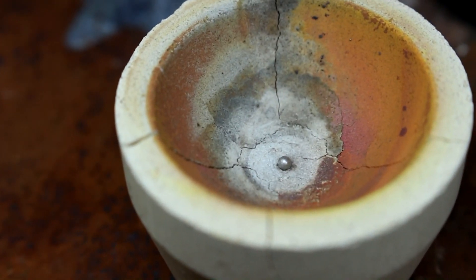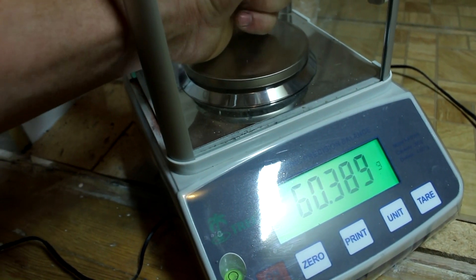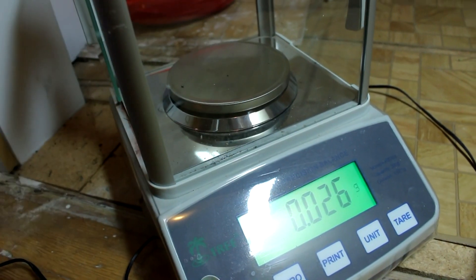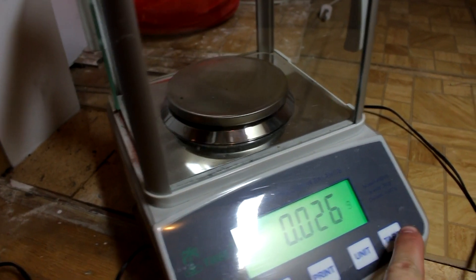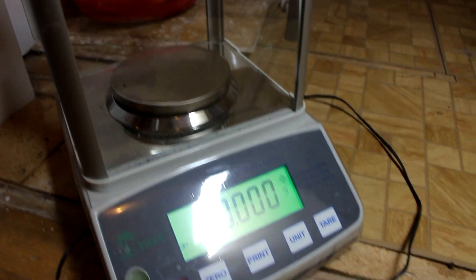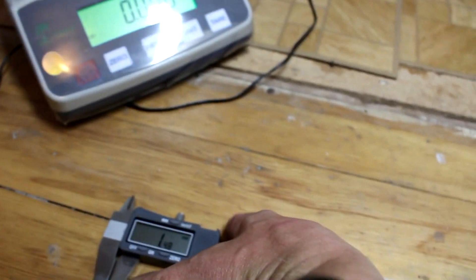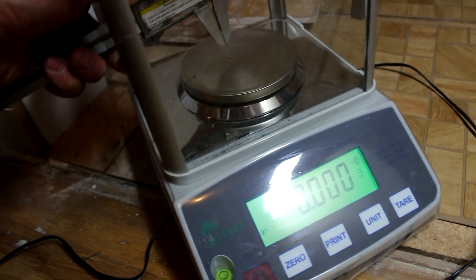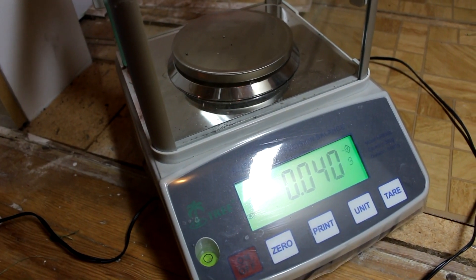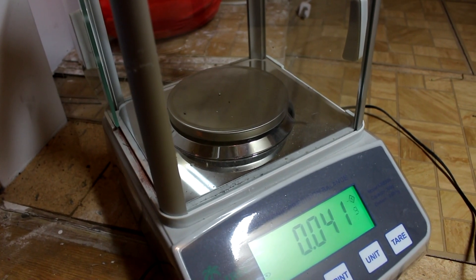It's a little bit smaller and a little bit less shiny, but it should be pure platinum now. Here are the iridium wires from the spark plugs — let's see how much they weigh. 26 milligrams. That's not very much, and it's even less significant because iridium is incredibly dense. Now I've got my platinum bead in these calipers — as you can see it's one and a half millimeters wide. Let's put this on the scale and see what it weighs. 40 milligrams. I was hoping to get a little bit more, but that works out to about 2 milligrams per spark plug, which seems reasonable.